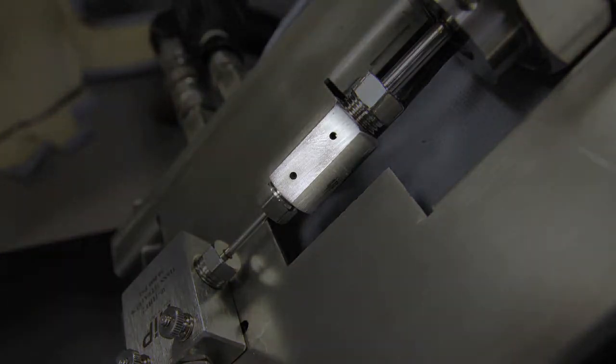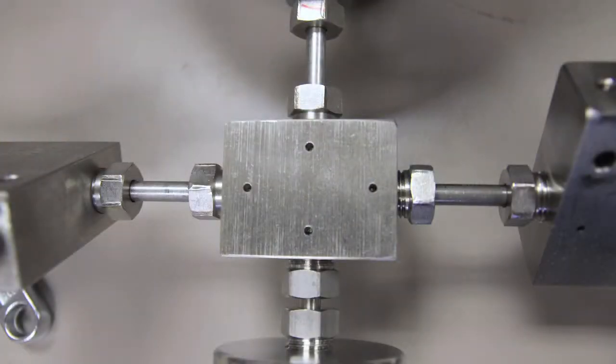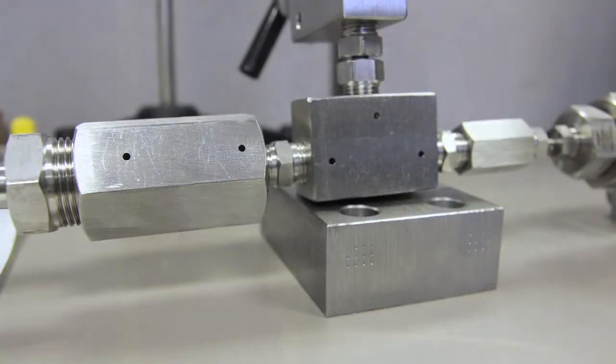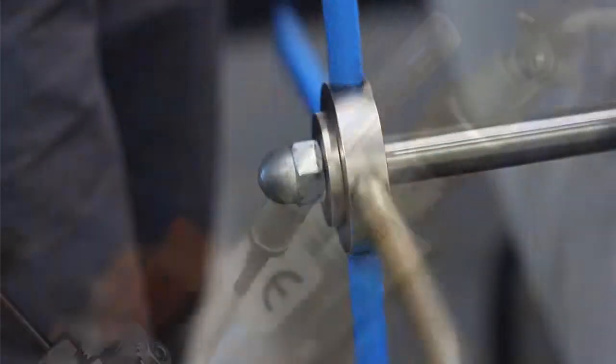Inspect weep holes and all of the fittings. Now you know how to load a sample and check for leaks in your ViscoLab PVT system.